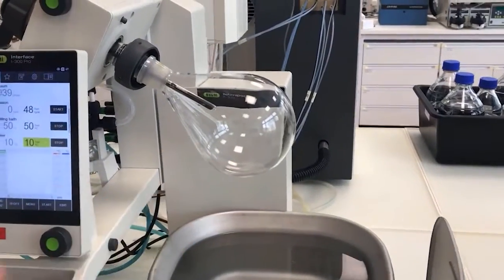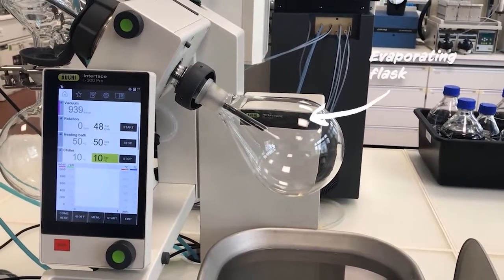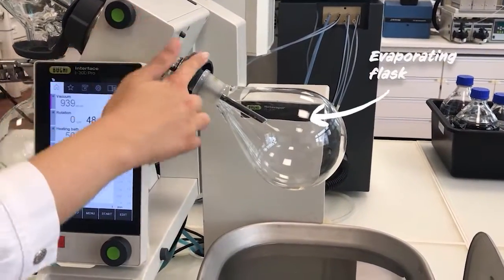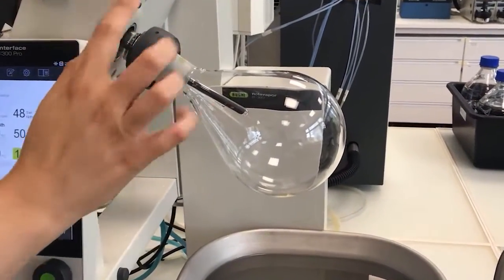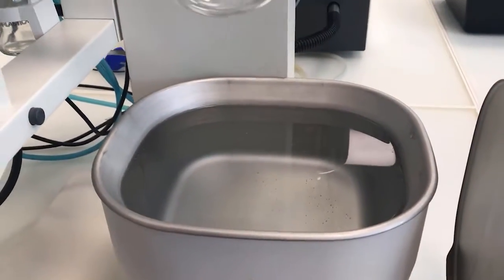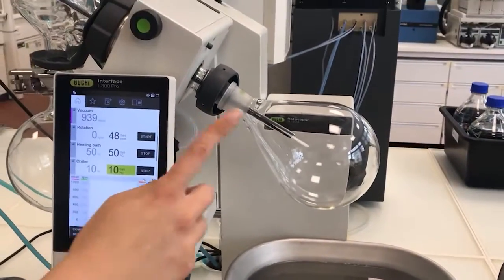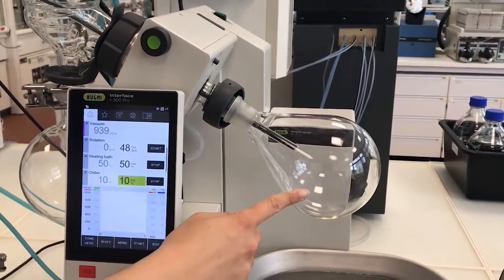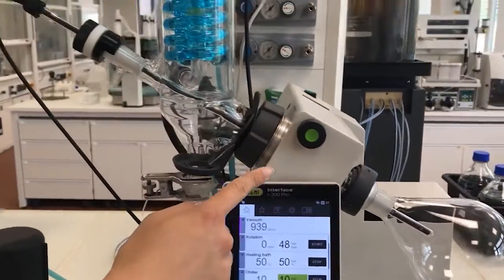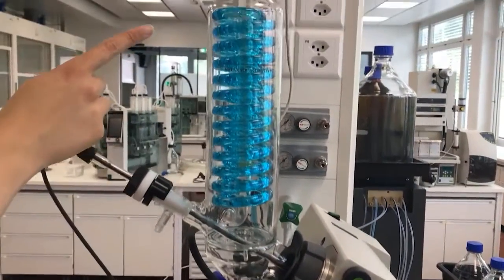The flask with your sample will be attached to the glass joint and submerged into the heating medium. Upon reaching the lowered boiling point, the vapor will then travel through the vapor duct into the condensation area.